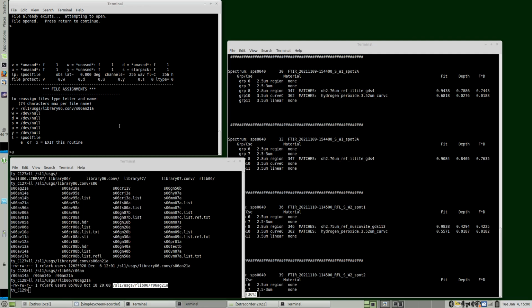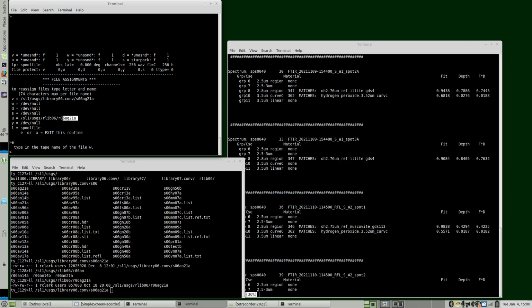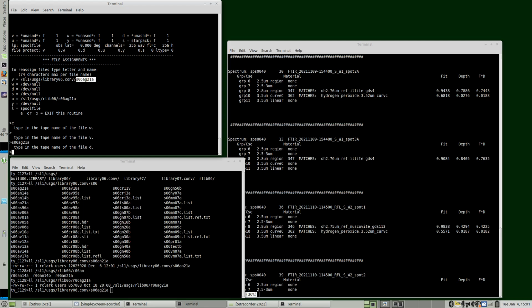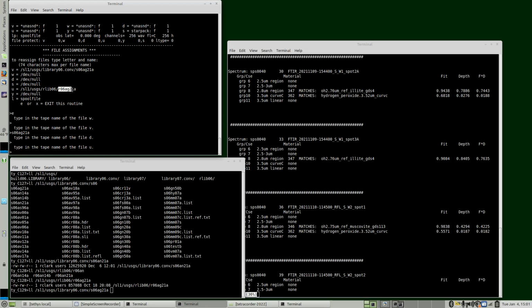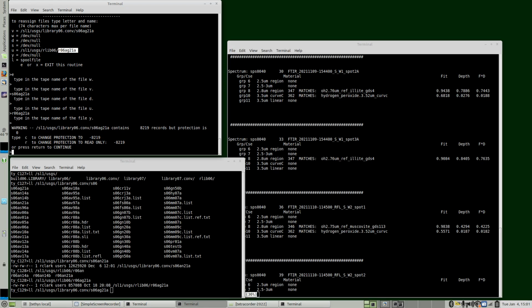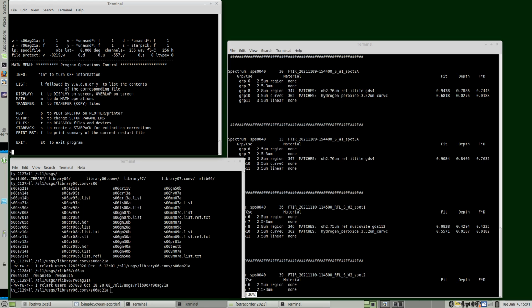So we'll assign U to AG, and we have to reassign this one. So we want this file, not the AN file. So that's simply that, it'll reassign it. And now we have AG21 here and AG21 here. We're done here. In the setup, we'll have to give it a name, so just copy the name. It checks the file sizes and sets the protections to read only, and that's fine. Okay, so we're basically set up.